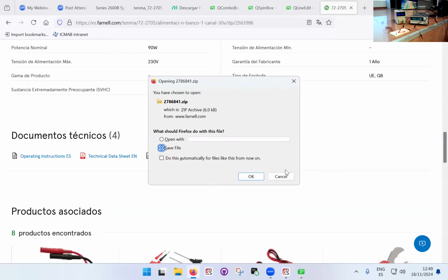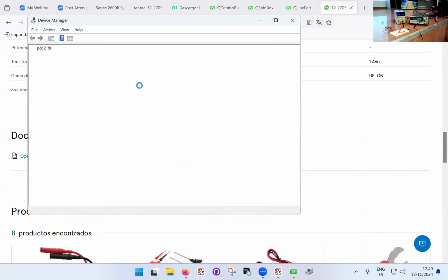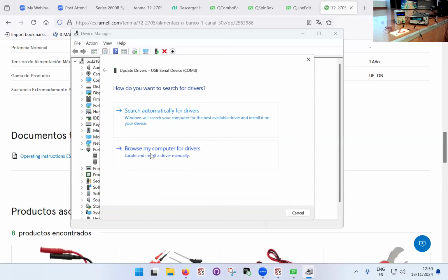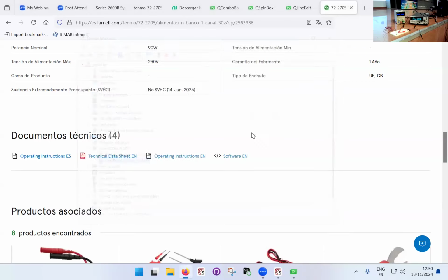You have to install this driver, or at least go through the device manager of Windows. That's a typical thing: you plug it in, and generally you'll notice an object will appear. If it's a serial instrument, it will appear usually in the ports section of the device manager, but it will come up as an unidentified device or something like that. Then you right click and update the driver. If you've downloaded it, you can try to search automatically, which is what happened with this computer. But on the other computer, I had to browse for drivers, and you have to pick the folder where you downloaded the file. Once you do that, it knows how to communicate with it, and that's it, all done. And in principle, it should work.